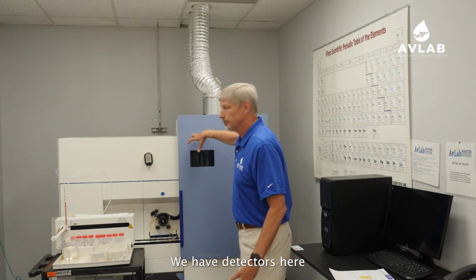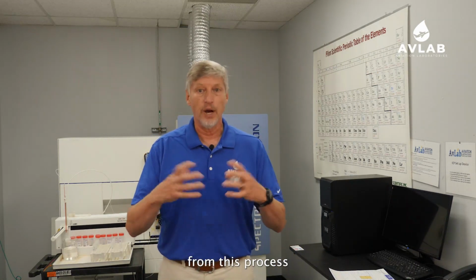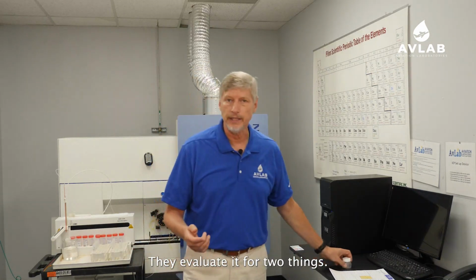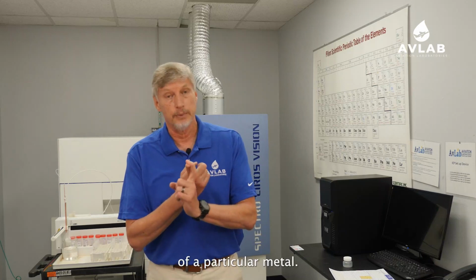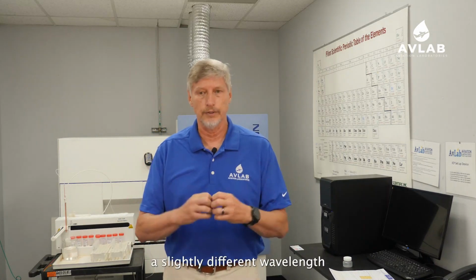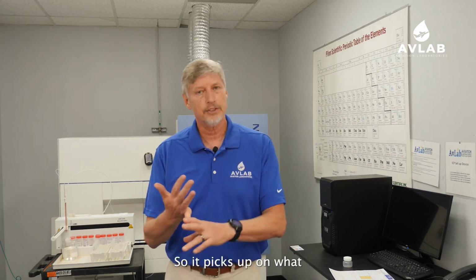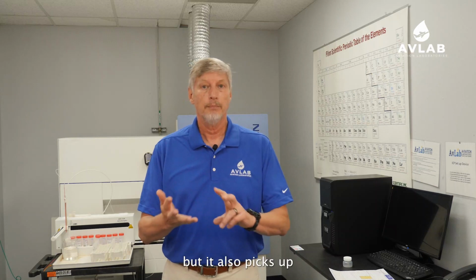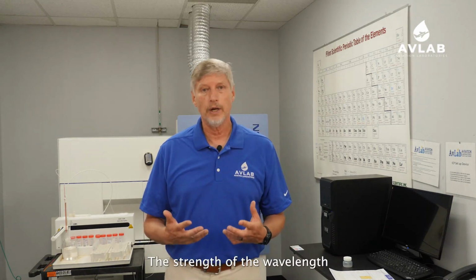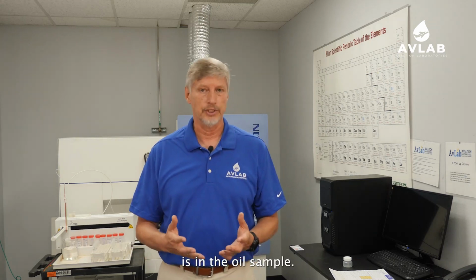We have detectors here that pick up the energy from this process and they evaluate the energy. They evaluate it for two things. They look at the wavelength of a particular metal. Every transition metal has a slightly different wavelength when this process happens. So it picks up on what that wavelength is, but it also picks up on the strength of that wavelength. The strength of the wavelength tells us how much of that metal is in the oil sample.